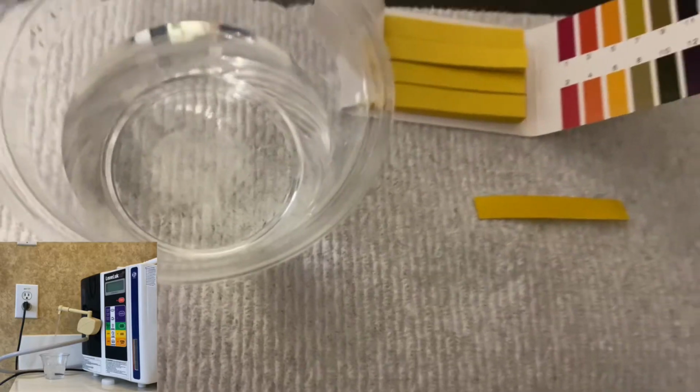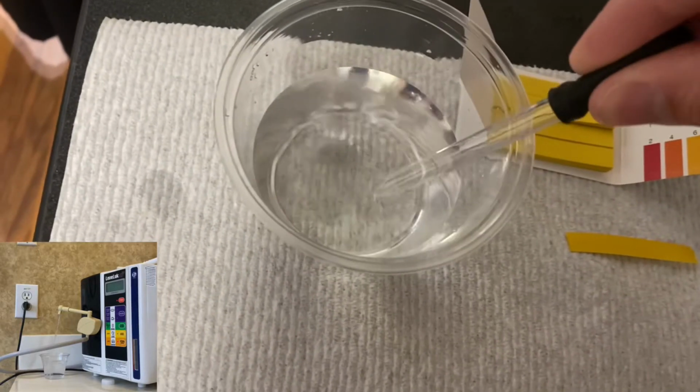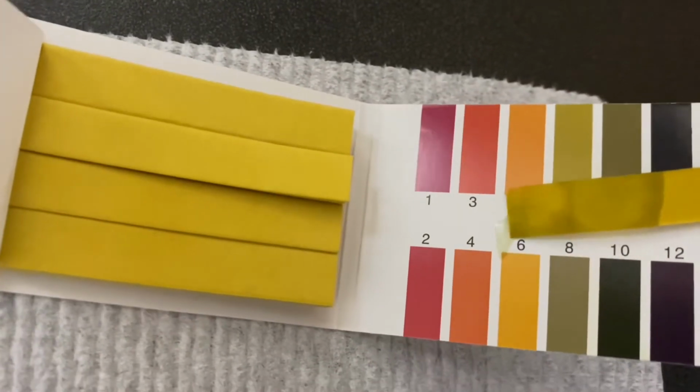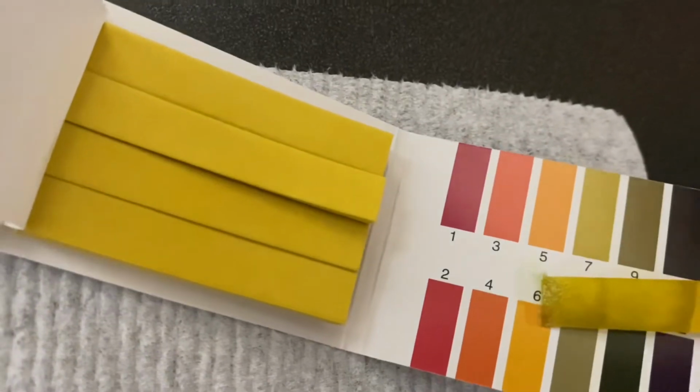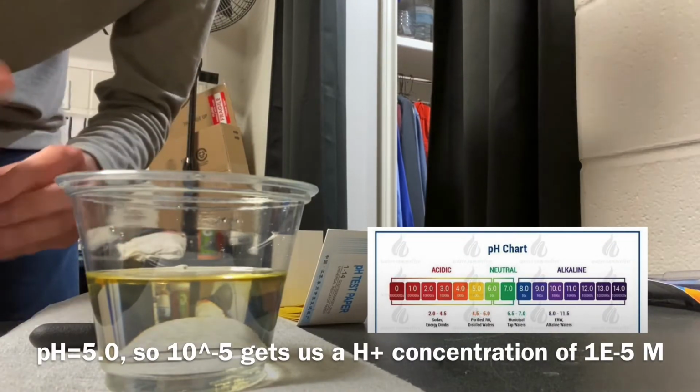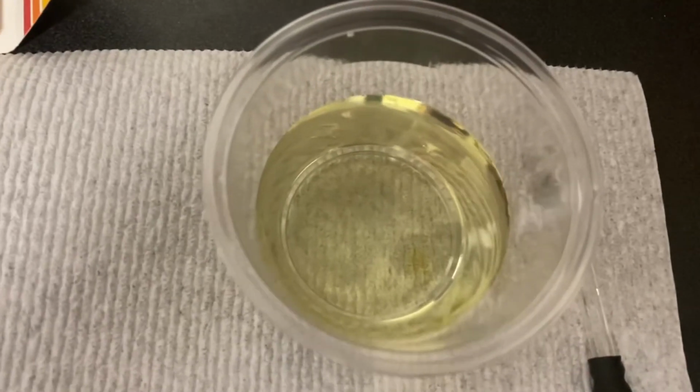To run a trial test, I have here a liquid solution with a listed pH of 5.0. According to this coloration chart, the pH listed should show this as a yellow-orange color, with some leeway due to my transportation of this liquid from my house to my dorm room having an effect on the hydrogen ions. Testing this on the pH test strip paper, we can confirm that the solution is indeed close to an acidic 5.0. Adding a drop of our indicator solution shows the liquid to in fact check out with the coloration, confirming the initial measurements. So now let's go ahead and move on to the tap water.